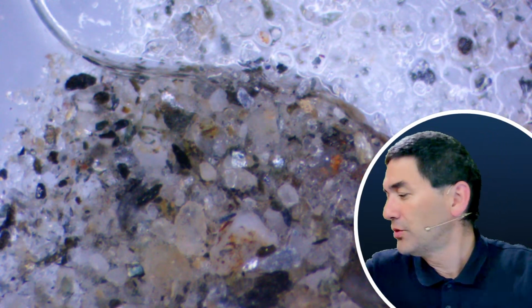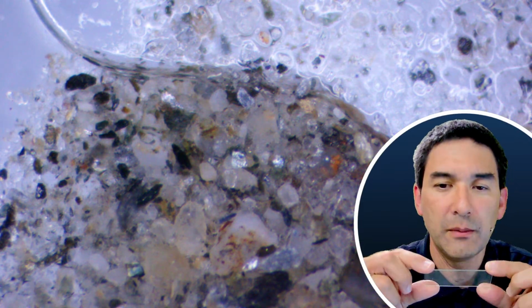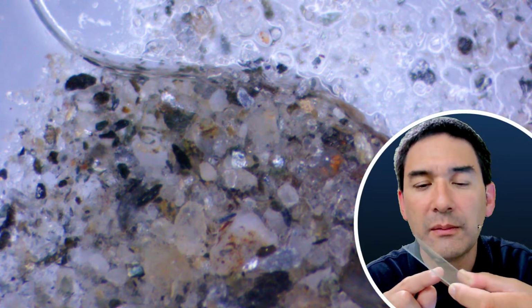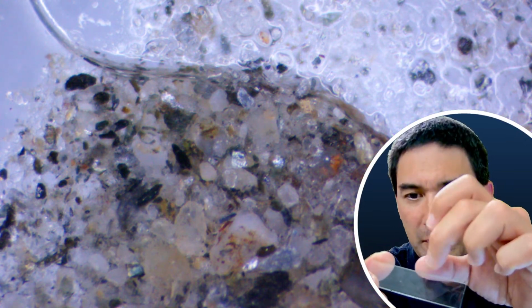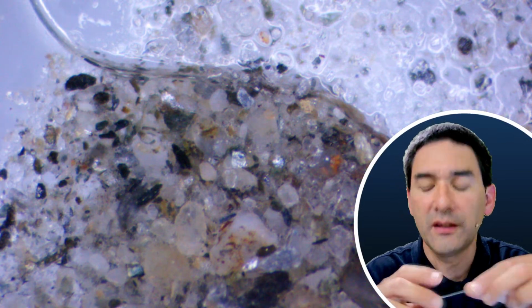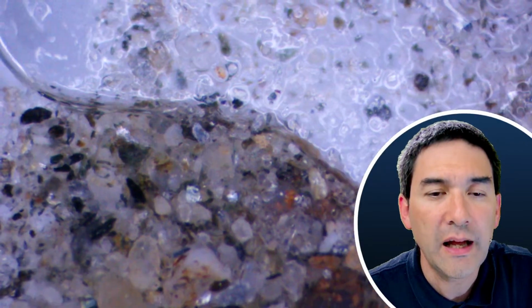And what I'm trying to do in the future, still not found the time to do that. Last time I also showed it to you. I do have some microscope slides that have a small indentation. They're a little bit concave, and this can be used as a place to put some slightly thicker samples. But I think that even the sand grains might be a little bit too thick for those slides. But I'll see. So that's the next project that I have.